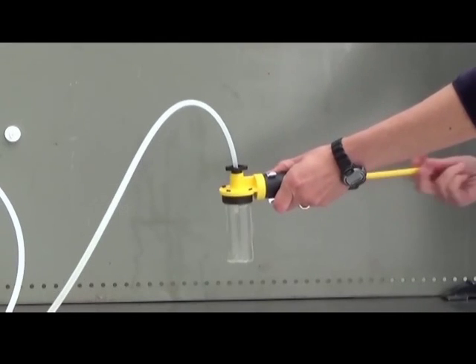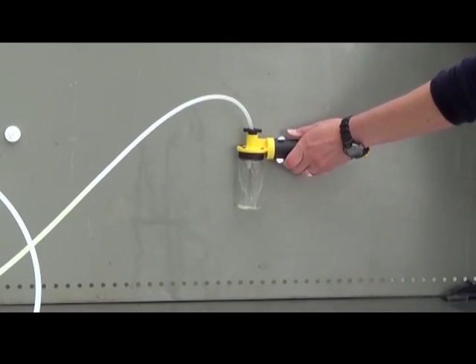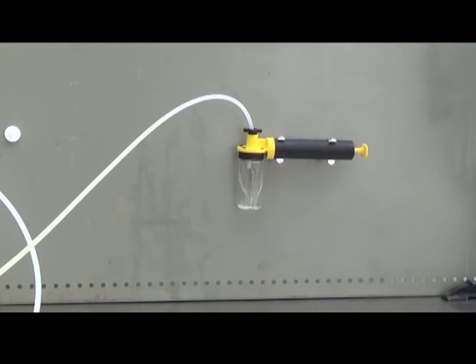Here we are showing sampling of high density oil at a temperature of minus 18 degrees. If you want to make this process go faster, you can pump up a higher vacuum by using about six to eight strokes. Hang the pump up whilst the bottle fills, as it will take some time.